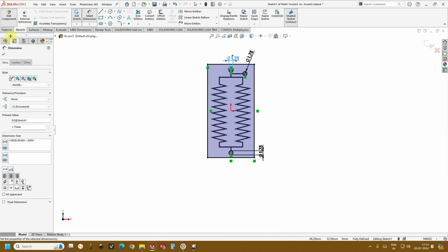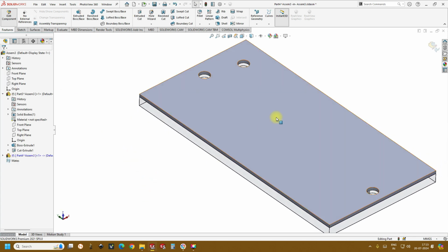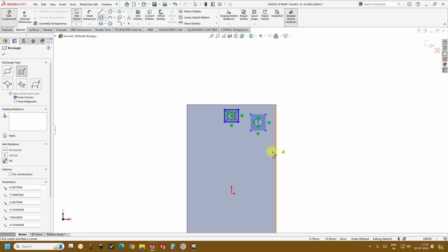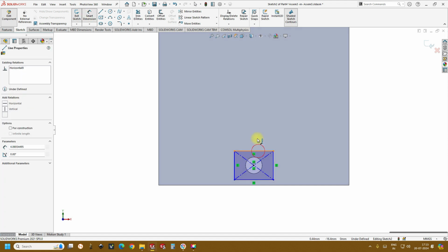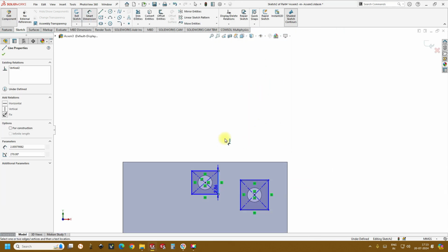Okay, and now go to features, extrude boss, and let's create a height for the covering material of 0.5 mm. This is sufficient just to make an enclosure. Click OK, and then click on this, create a surface, and now let's create the extrusions for inlets and outlet. So I'll keep it as 3 mm cross 3 mm. Similarly here 3 mm.